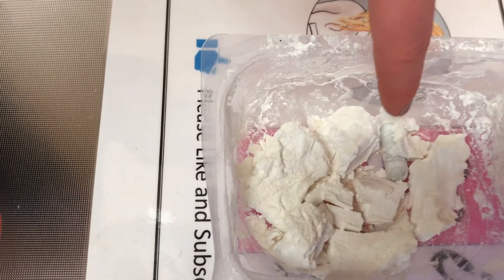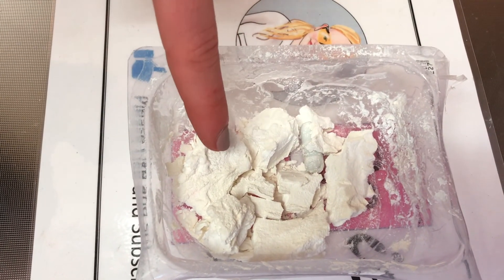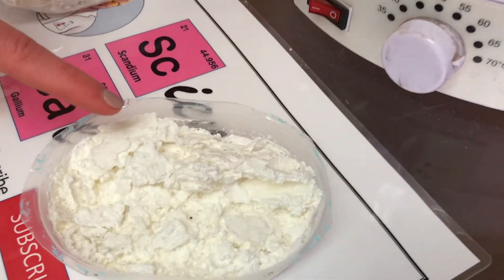Here is my product of calcium hydroxide, note the stir bar is still in there. And here is my sodium acetate.